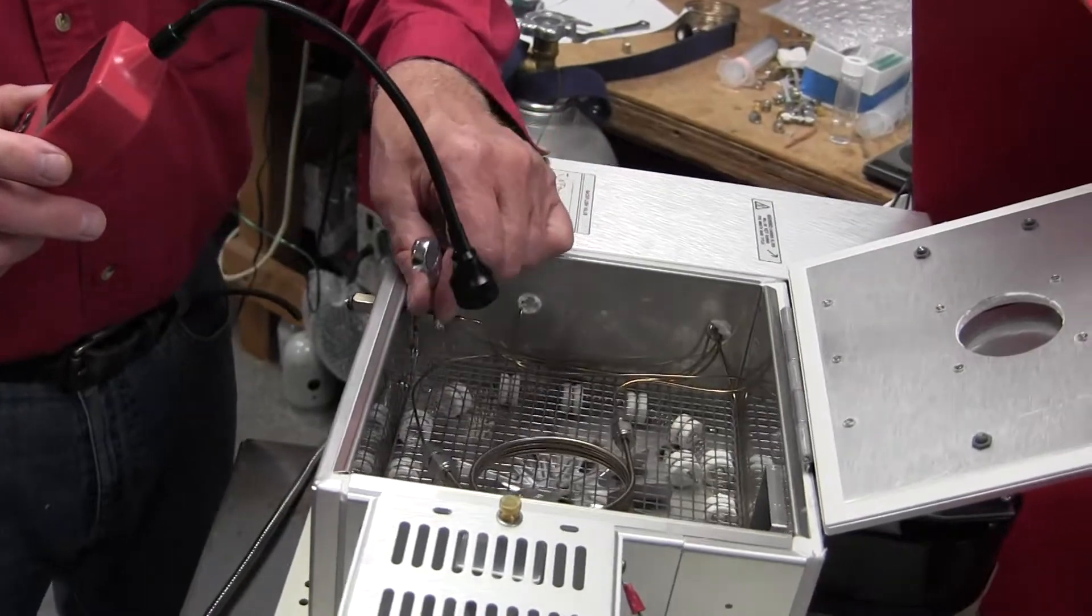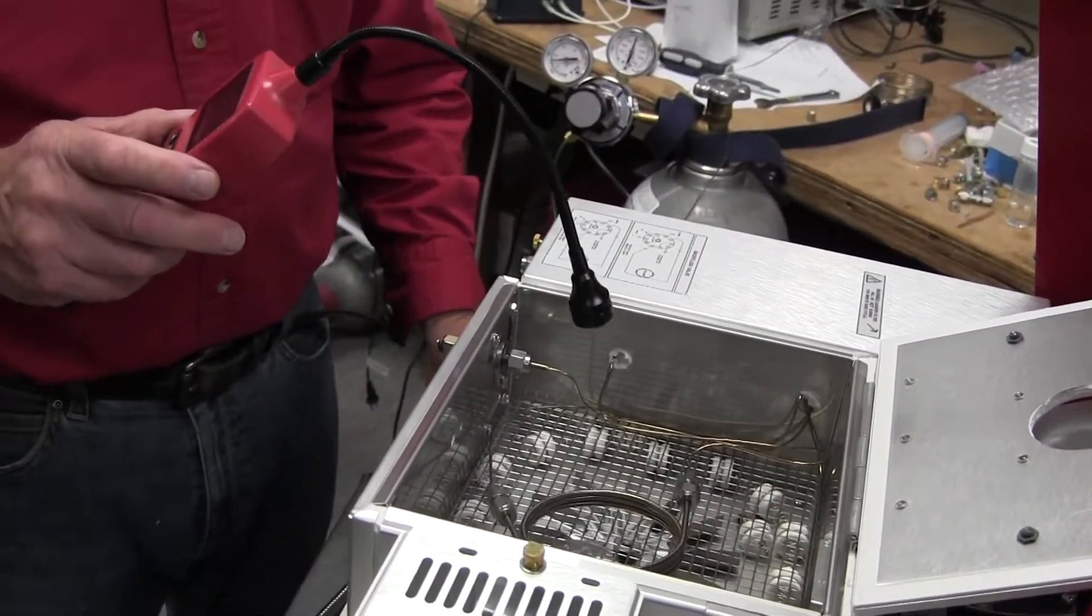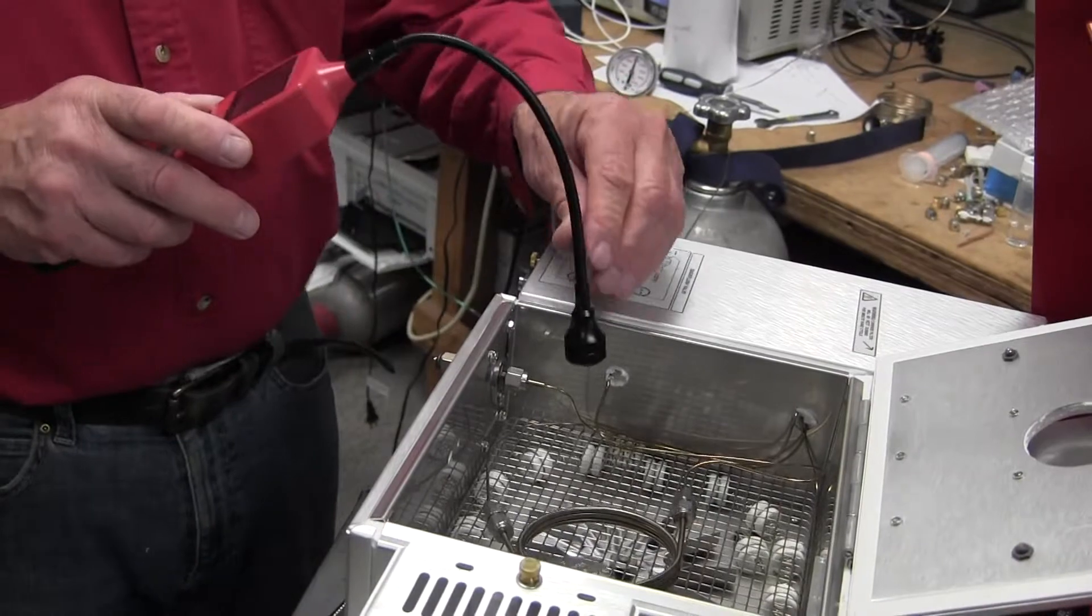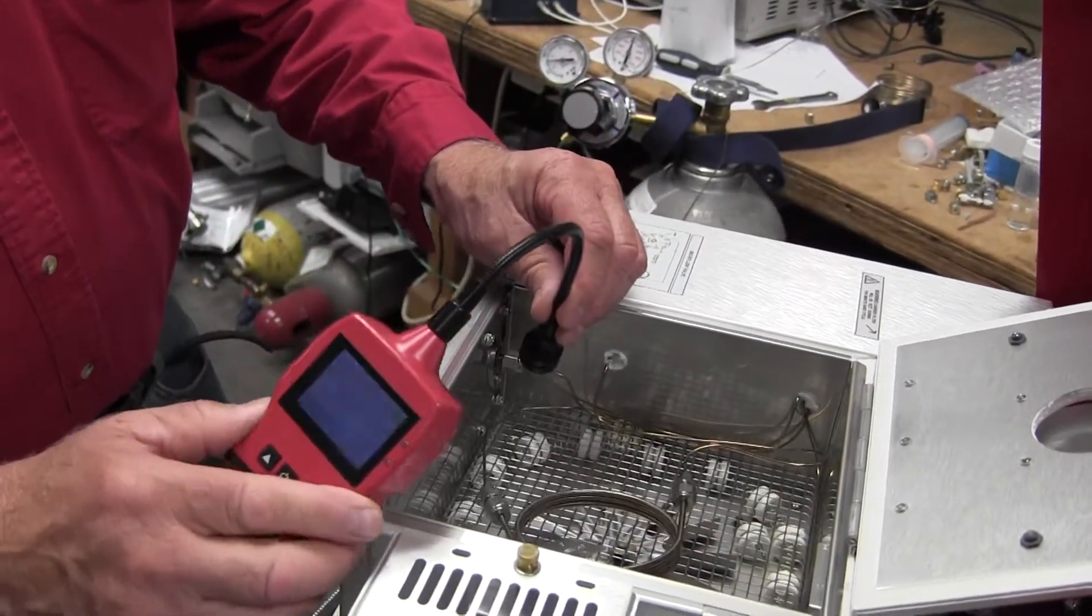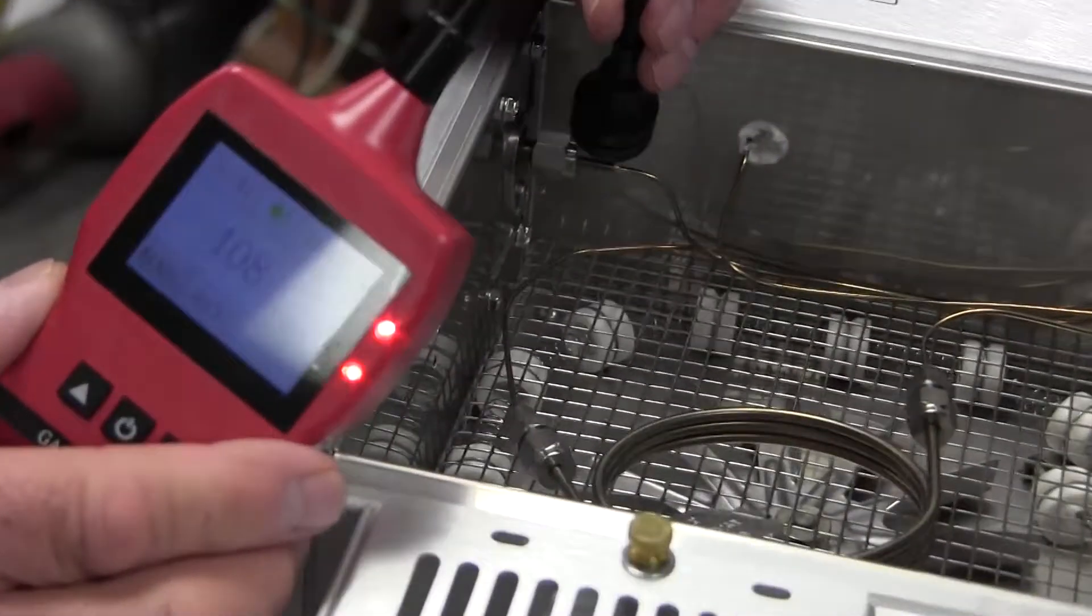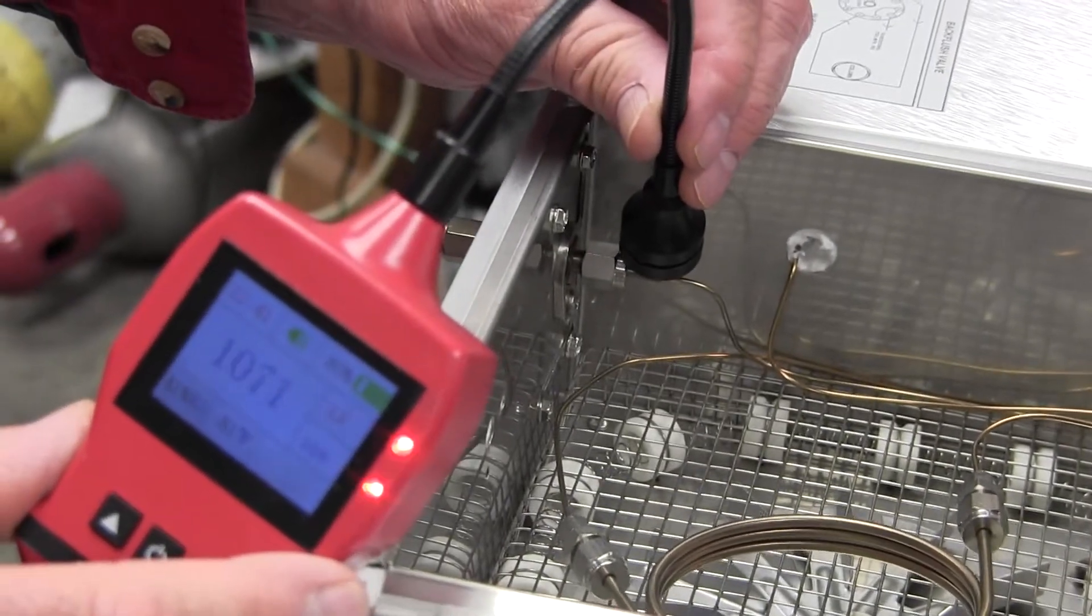I'll make a little hydrogen leak intentionally, and then we'll see if we can pick it up with the sensor. See how the sensor's going off when it senses the hydrogen leaking out of that fitting?